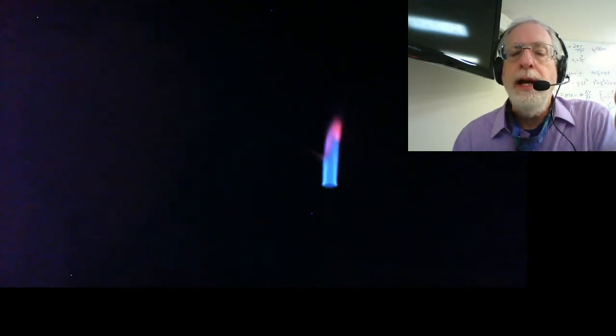So the water has boiled off, and I'm holding a splint in the flame, and I'm pausing the video here, and you can see it. And this actually is kind of nice because you can pause it online and you can really see the color that this forms. So that's the color that you're trying to describe for this one. And you can go back and play it back again. Actually, kind of got a nice little bright one there at the end too, it looked like.